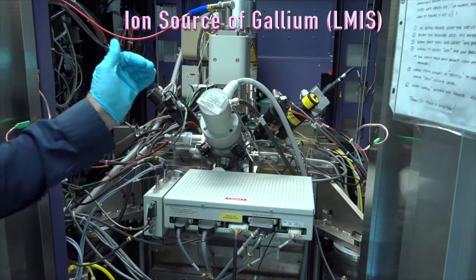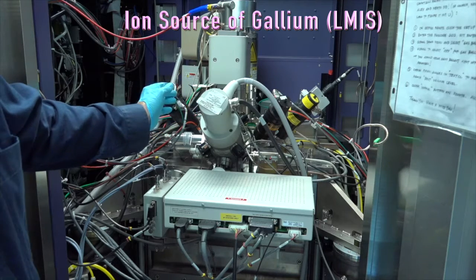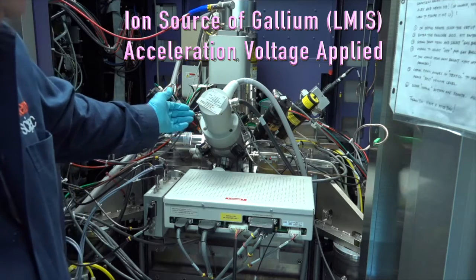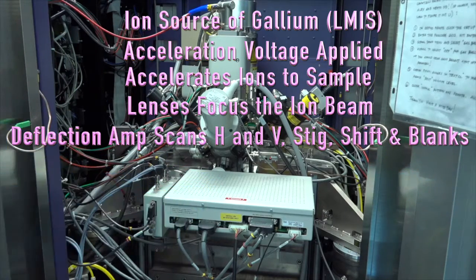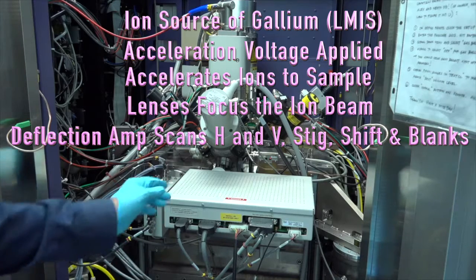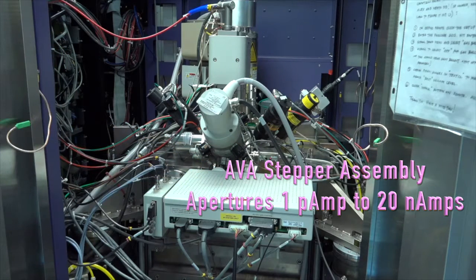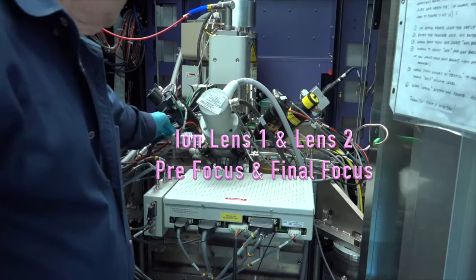So basically we generate an ion beam. That's the source, the liquid metal ion source. We accelerate that source, and it'll begin to emit, and then we control it with this box. On here we also have, you can just barely see the top of it here, the AVA controller, automatic variable aperture strip controller, exactly like the one for the E column, but the apertures are different sizes. And lens 1 is here, lens 2 is just below it.